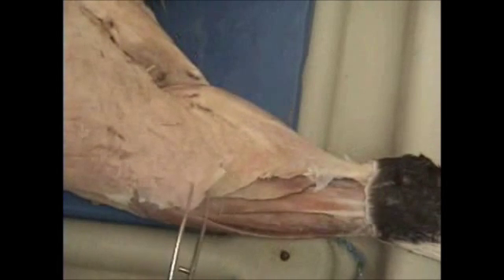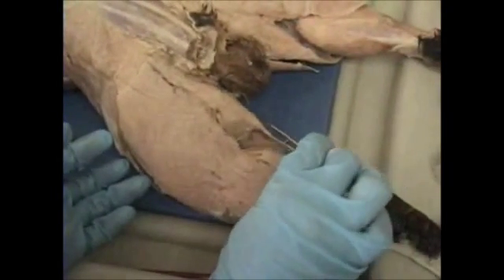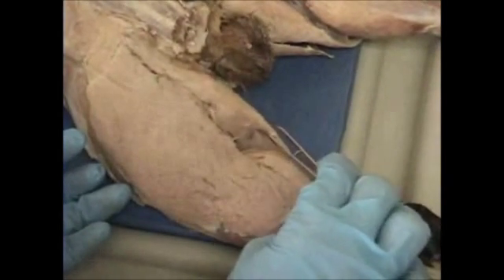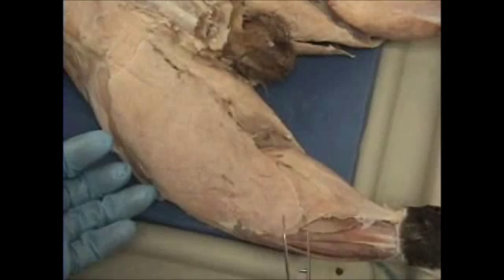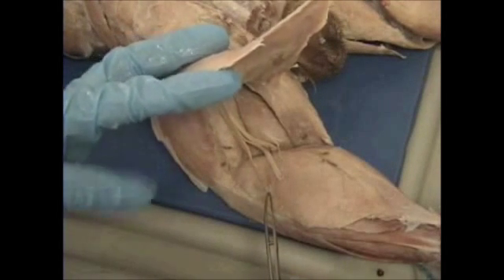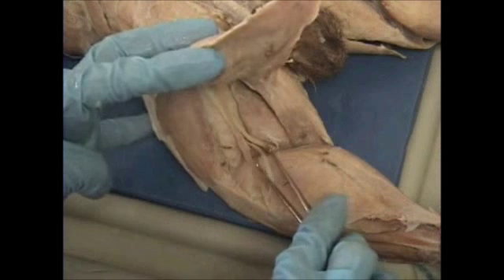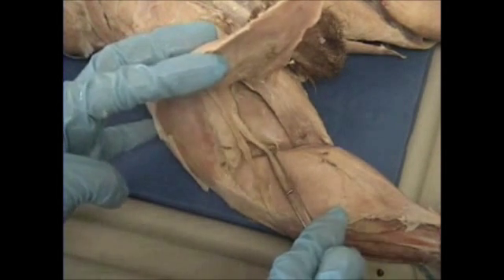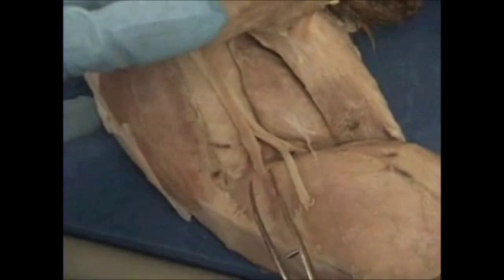Continuing up the leg, we have our very large muscle known as our biceps femoris. On the medial portion of the back of our leg we have our semitendinosus, and on the lateral portion, biceps femoris. We need to know one muscle underneath your biceps femoris, known as our tenuissimus muscle. Don't get confused with the sciatic nerve — nerves are normally very tough, hard to cut, and somewhat white, whereas the muscle is a tan color. So tenuissimus and sciatic nerve.